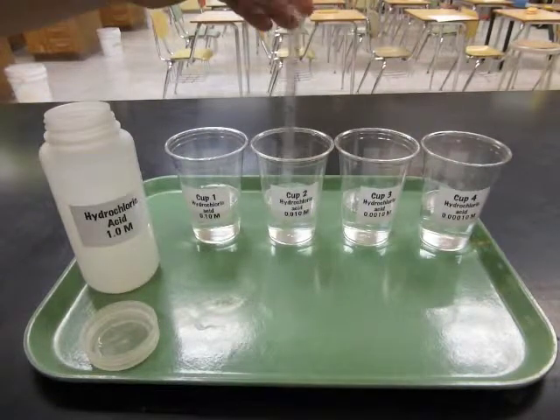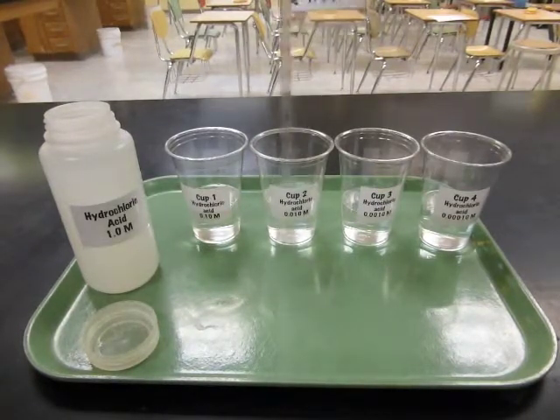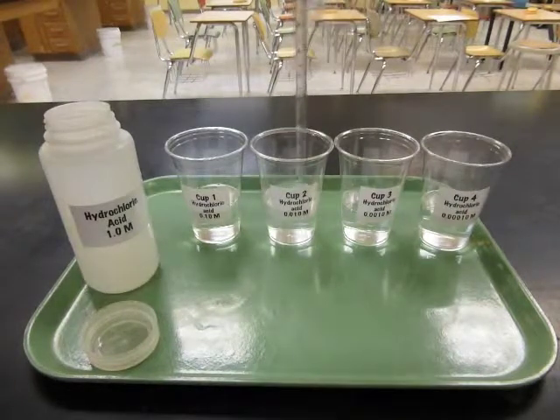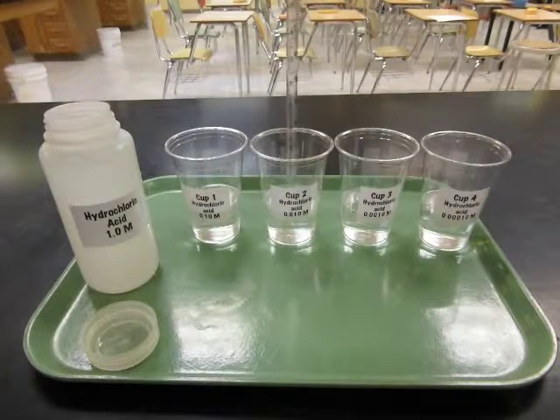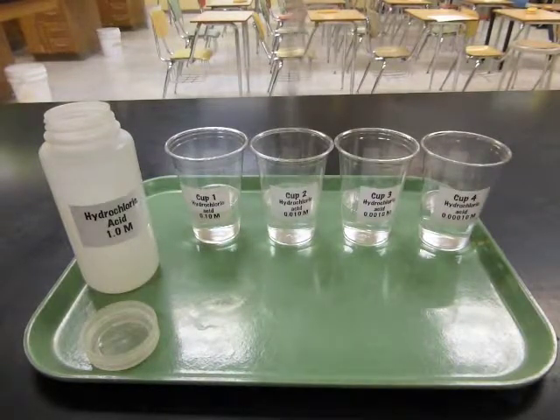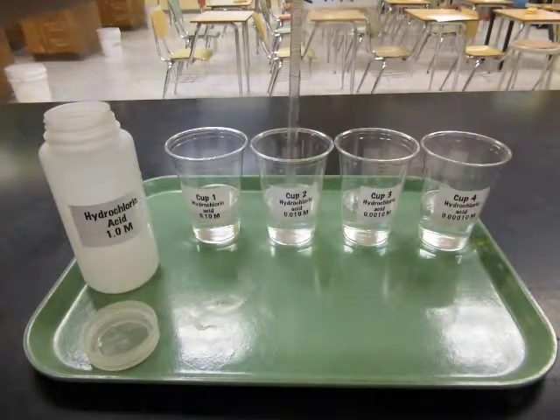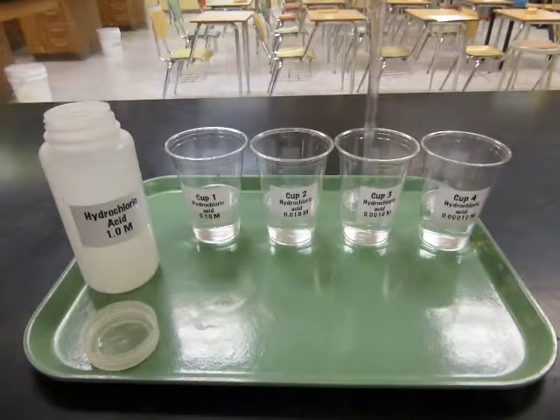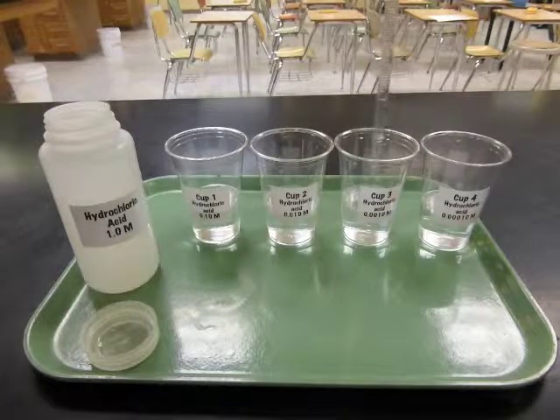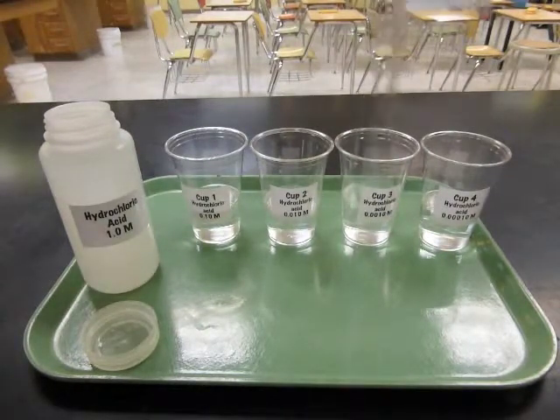So now this should be 100 times less concentrated than what I started with because I divided the first step by 10, and then I divided that 10 by 10, so now I'm up to a 100-fold dilution. Let me draw that in and out of the pipette a couple times just to make sure it's really well mixed. The better mixed this is, the more your results are going to make sense. Alright, then I'll go to the next one. I'll draw 10 milliliters up and go to the next cup. So that's why we call this a serial dilution, because it's done in series, one after the other. Okay, swirl that around and mix.